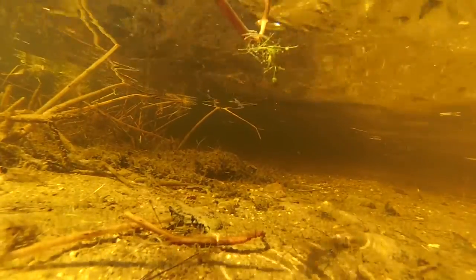If you make a muddy mess of the site before sampling, see if you can wade over a bit and try another spot. Make a note if any of the disturbance seems to affect your samples. Try reaching as far as you can away from your feet to a spot that's less affected.